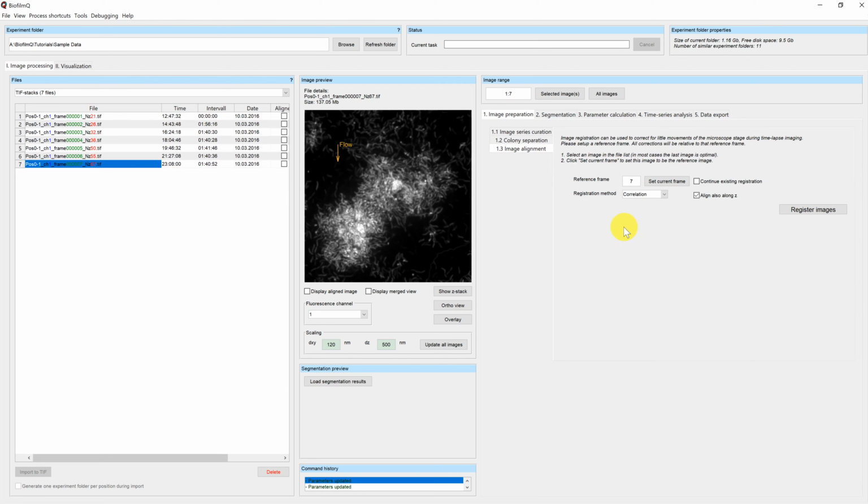You have two options you can pick for registration method. One is correlation-based, the other one is mean squares-based. The correlation-based approach is very robust even for large drifts, as long as your sample is in focus. If you don't have in focus images, the correlation algorithm struggles to find the perfect location.